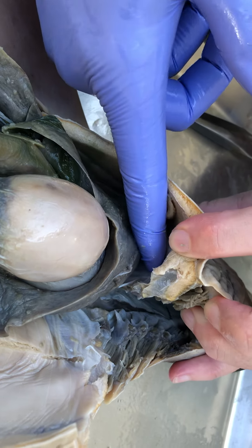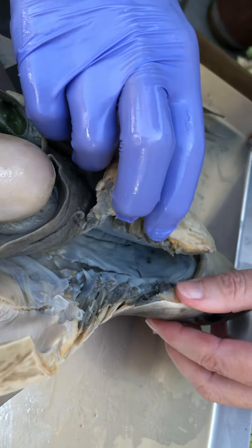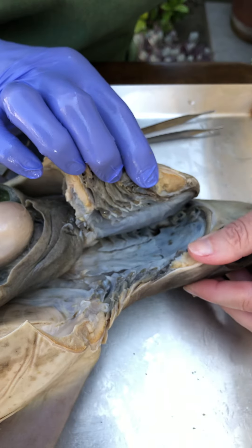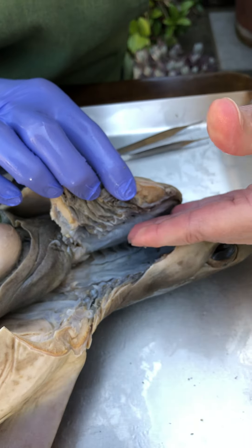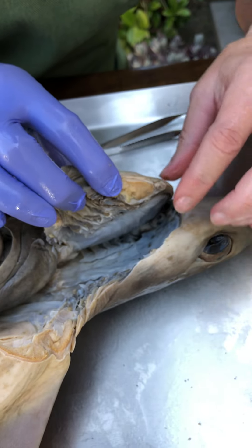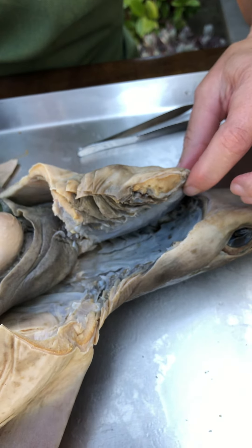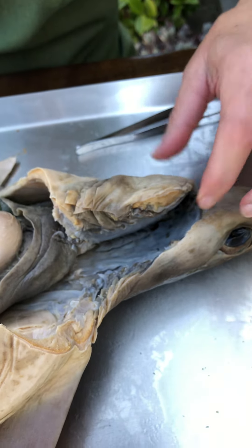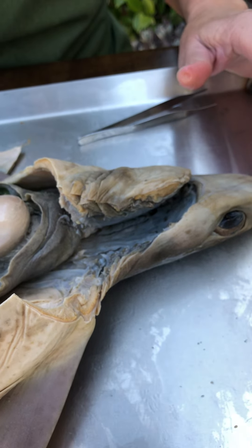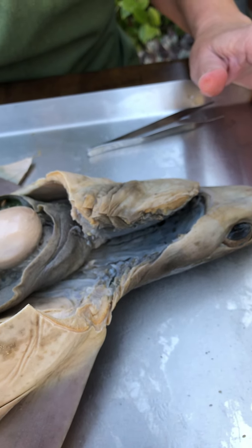The transverse septum is damaged here by this opening, which takes us into the oral cavity and the pharynx, and we'll have a look there later. So that's how we open it up, and now we can start touring around the internal anatomy of the shark.